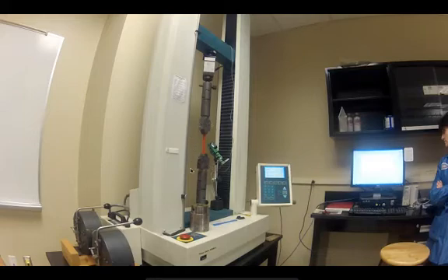For this experiment, the extensometer was not placed on the material due to the amount that the specimen was going to stretch.